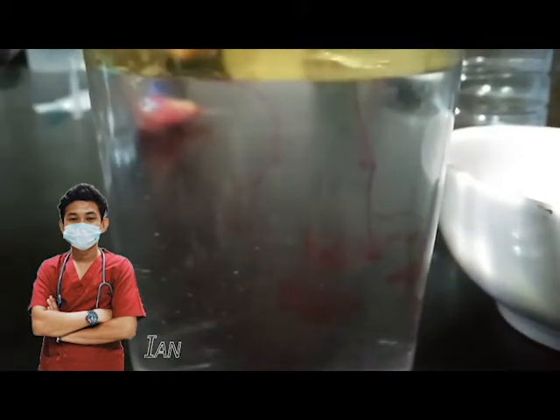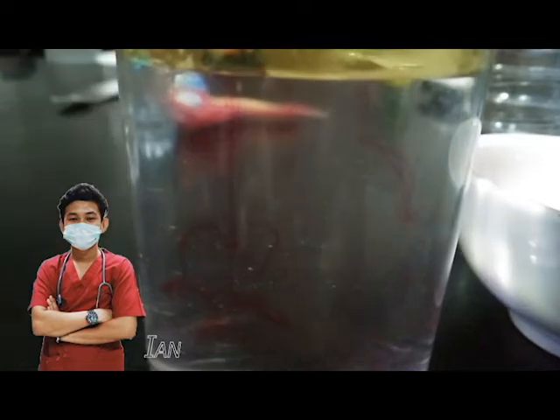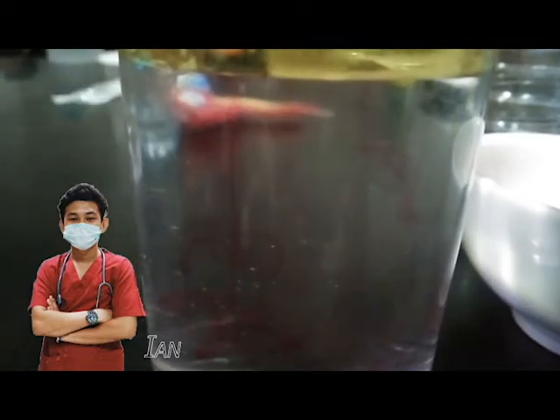The water has no concentration of food coloring, which means that the flow of food coloring from the oil to the water comes from the higher food color concentration to a lower one. This explains how diffusion is taking place by the movement of food color from a high concentration to a lower concentration. Given enough time, the food coloring will mix thoroughly with the water evenly.